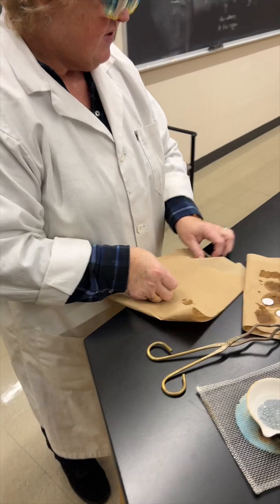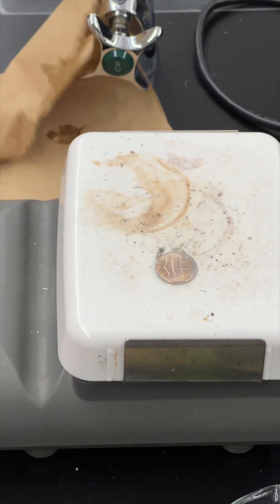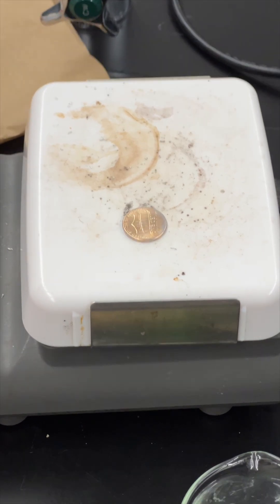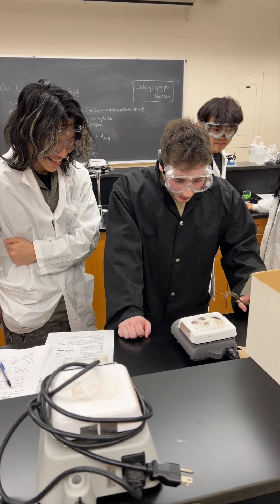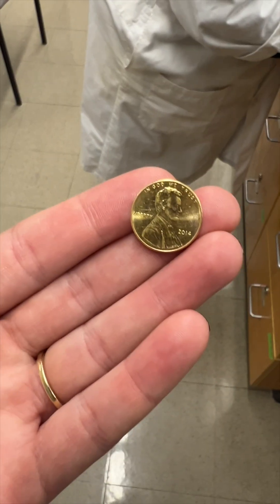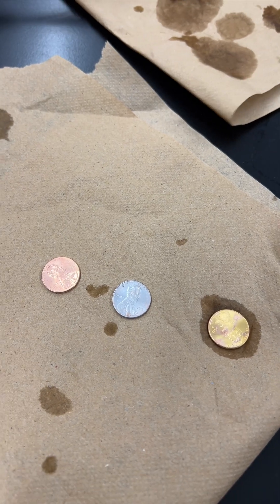Come take a look at my pennies. I've got this hot plate — all I'm going to do is stick it on here. Can you start to see it changing? All three of them on there, you'll start to see some magic. Oh, it's cool, right? It's so nice.